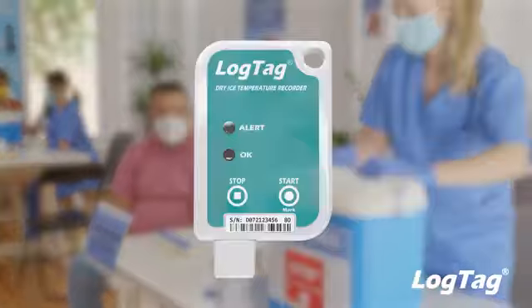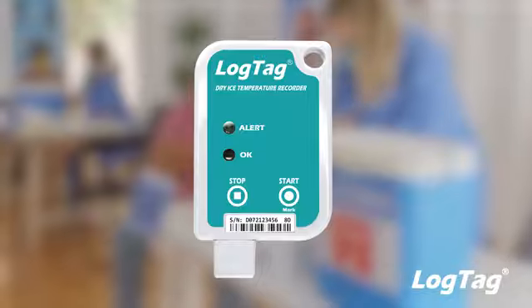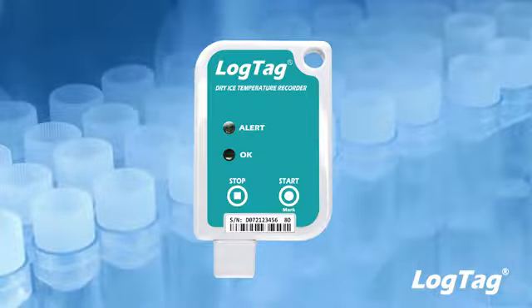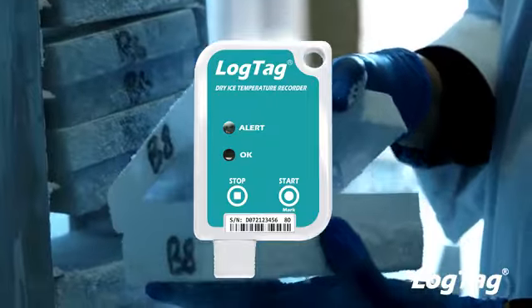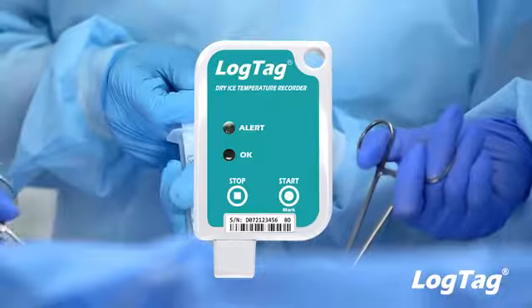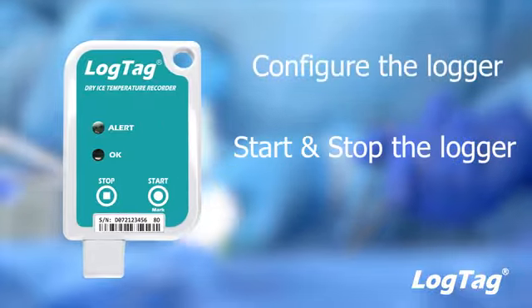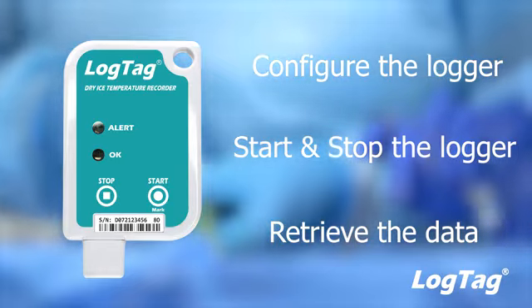The LogTag Tril and Sril 16U are LogTag's latest ultra-low temperature recorders that reliably and accurately monitor and store temperature data at ultra-low temperatures. Designed and engineered for challenging environments, these loggers are the perfect solution for professionals who need to accurately and reliably monitor medical and pharmaceutical freezers and shipments utilizing dry ice. In this tutorial video, we will cover how to configure, record, and retrieve the data from your Tril or Sril 16U.